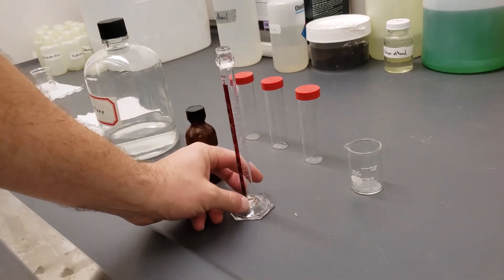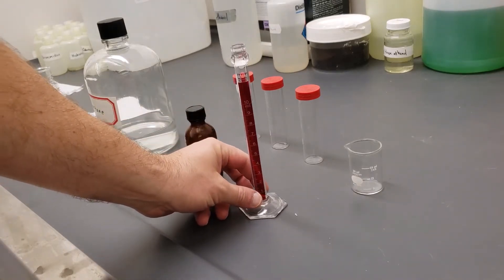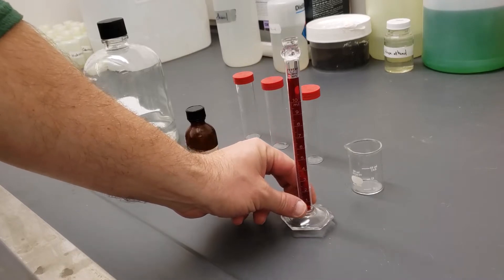I'm going to work in the fume hood to do this next step with these chemicals, especially the petroleum ether. I don't want to be breathing any of those vapors.